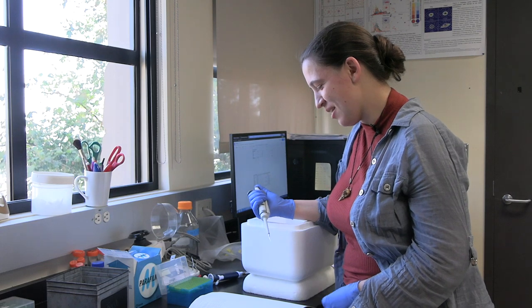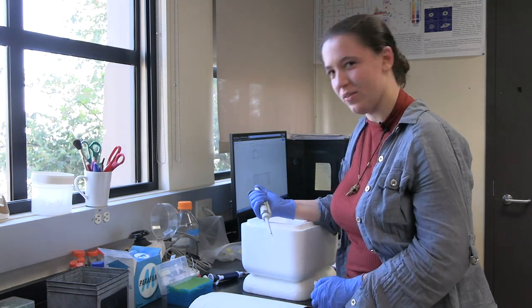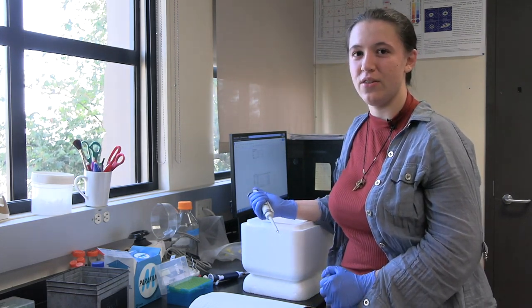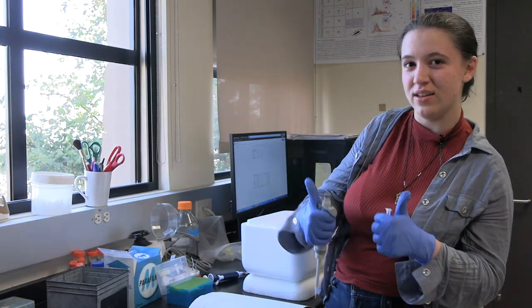Today I'm going to show you how to make a microtubule network. We're going to add kinesin to this, put it on the confocal, and see what it does.